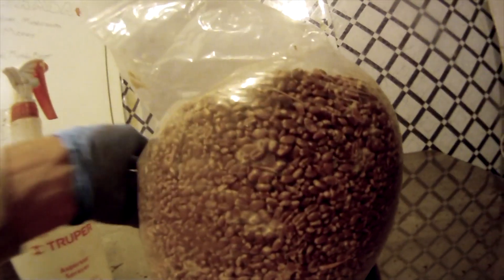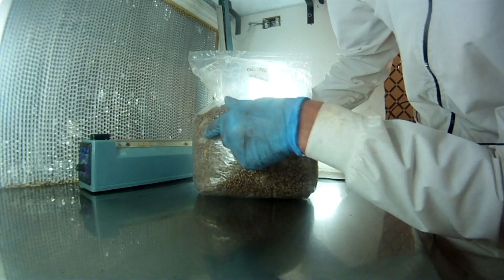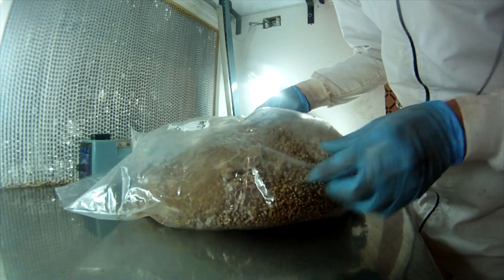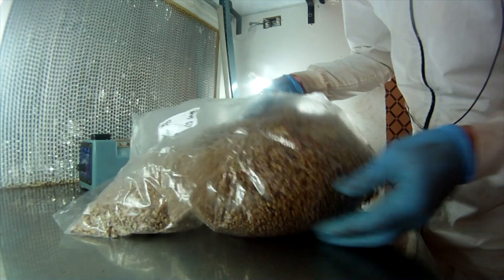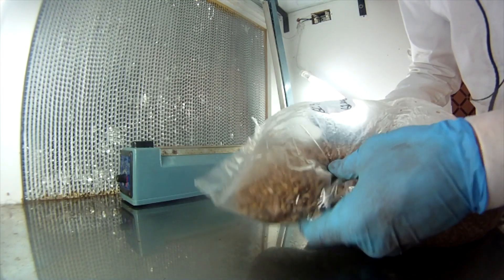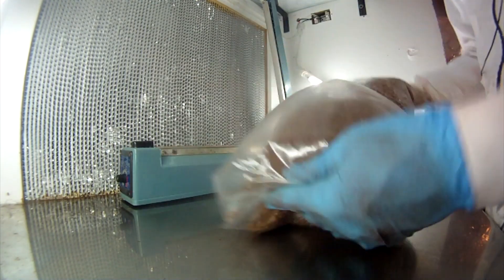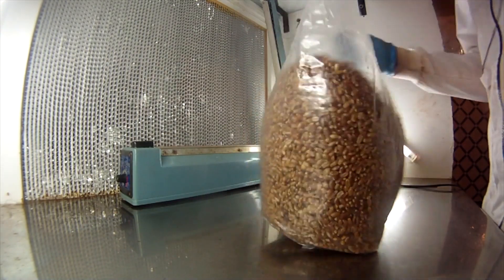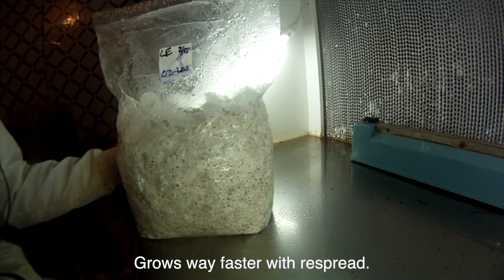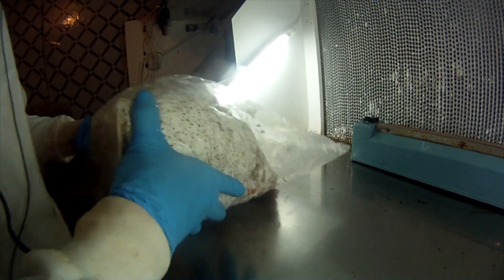I usually would say maximum three generations. So this is after probably just a few days, depending on the mycelium — a little bit of growth there. With the grain spawn, what you can do now — this is again a few days to a week later — you see those little chunks falling down, that's chunks of mycelium. I'm going to break those up by hand, find every little chunk, break it all up, and then mix it up and redistribute. This gets a nice even redistribution. It's a great way to do it with grain. I rarely do it with sawdust spawn, although you can — it's a lot more challenging. Now I've just evenly distributed and spread it out. That's what a completed grain spawn looks like: nice and white, colonized evenly. Look for any contaminants as you go — don't use them if you've got contamination.